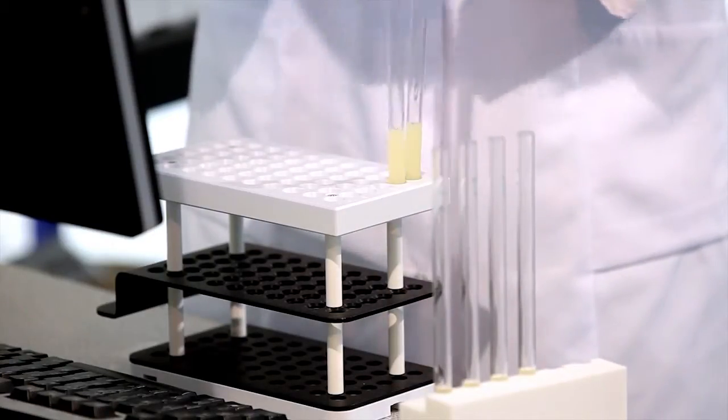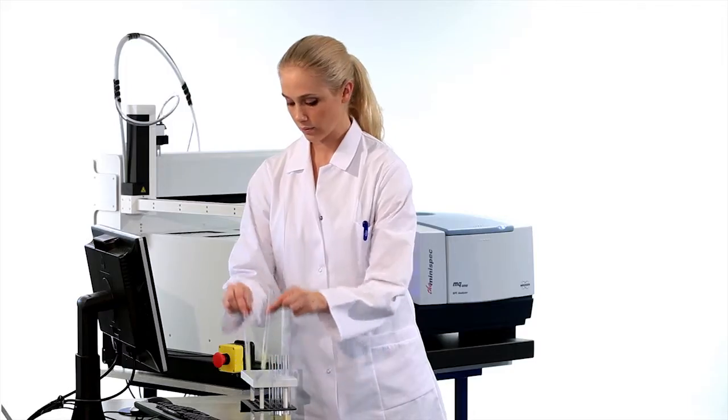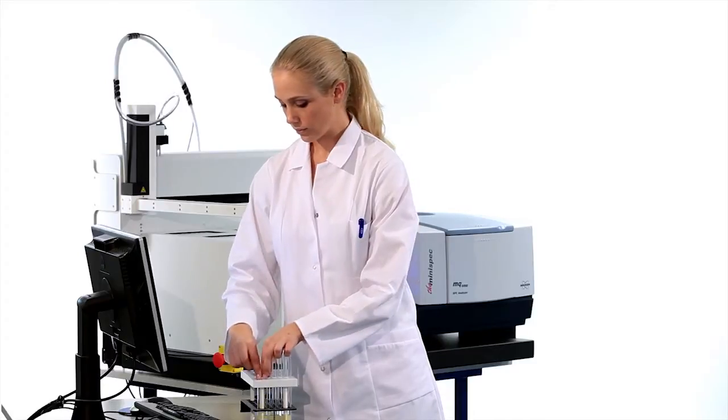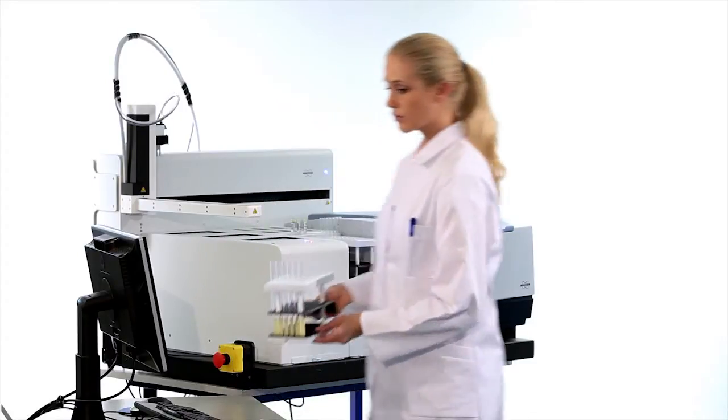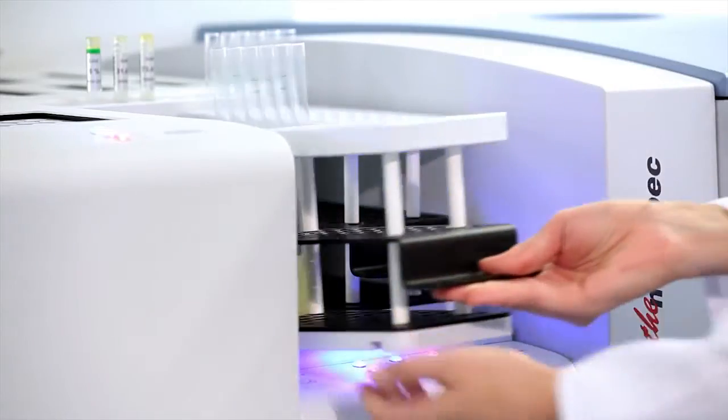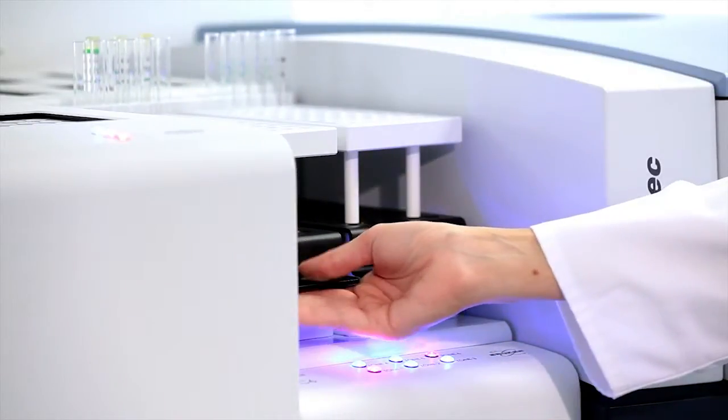The input tray is removed and the samples can conveniently be introduced. The sensor in the tray detects the input of the tray and the process can be started.